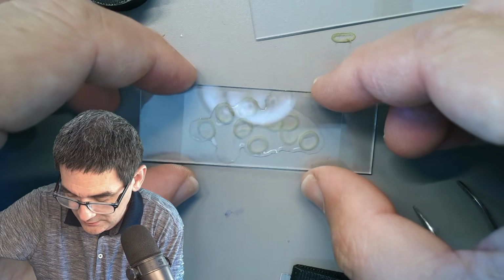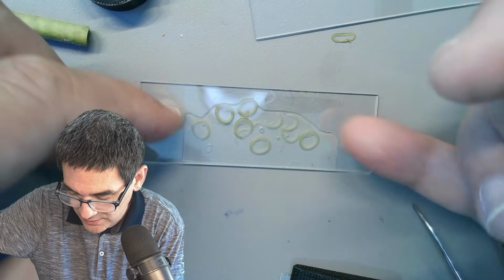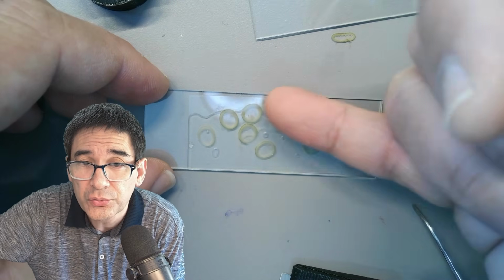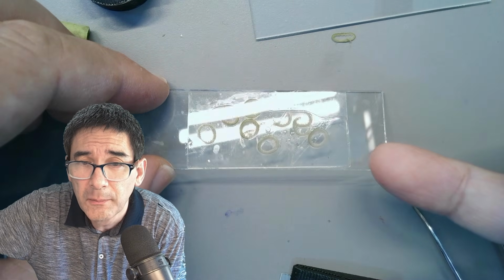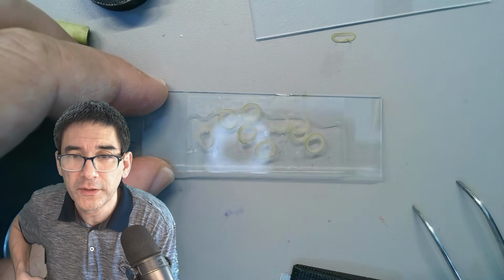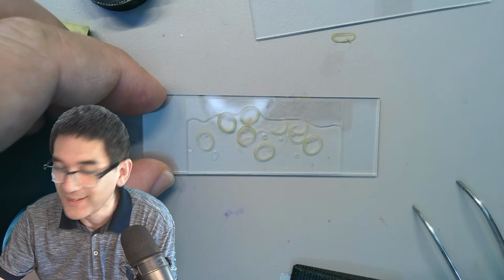Here we go. And look. Okay, you see it's okay. I mean, there's quite a bit of air here because those cross sections are fairly thick. But for first observation, I think it's going to be perfectly fine. Let's have a look. I'm already excited.